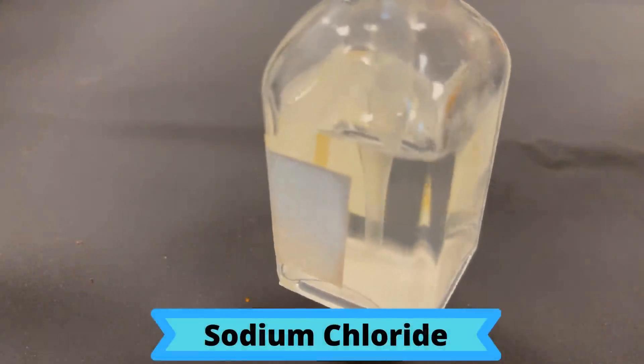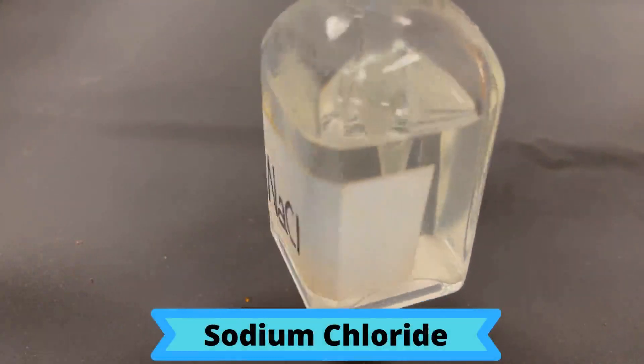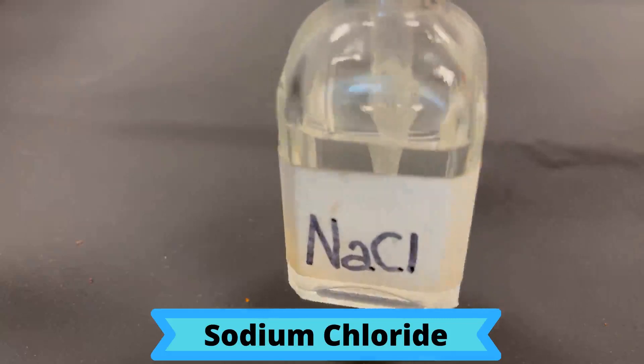Sodium chloride is a clear, colorless solution, and it's the same as salt water.